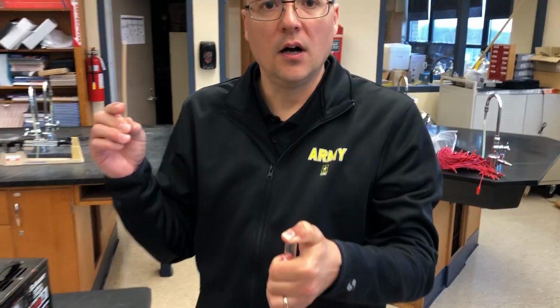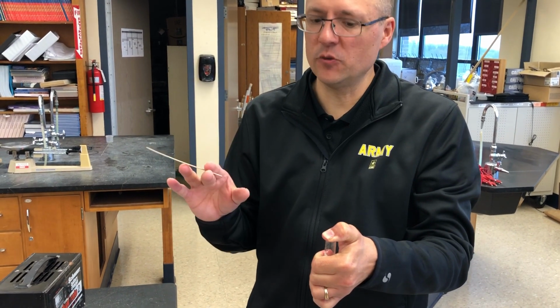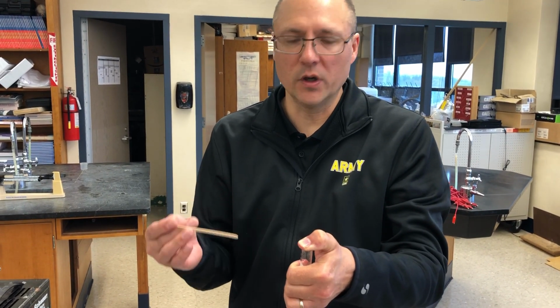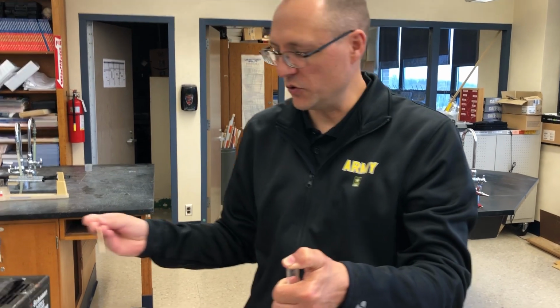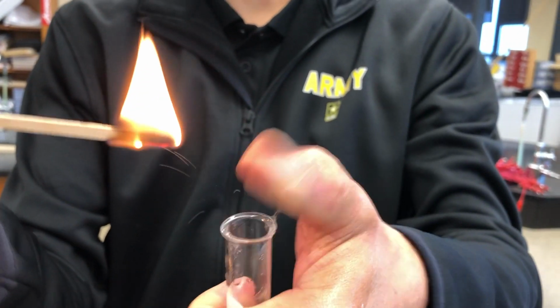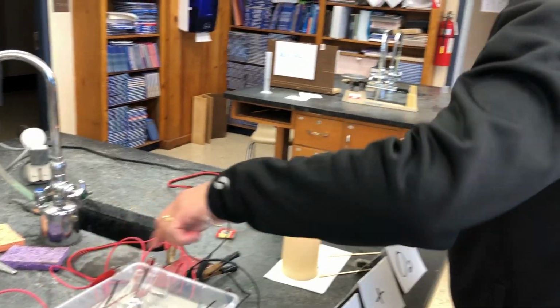Now you saw Mr. Dairyman do this with the hydrogen gas that was produced in part 2. We should get the same reaction. Now the difference is we only have one shot, one chance, one opportunity at this, whereas in the reaction that Mr. Dairyman did, the magnesium was constantly reacting with the hydrochloric acid and he was producing more, so he was able to do it again. So what I'm going to do is light this splint, and if this works out, we should get a pop or a whistle. There we go. And I can only do that one time, okay? I got one shot, one chance, one opportunity at that.